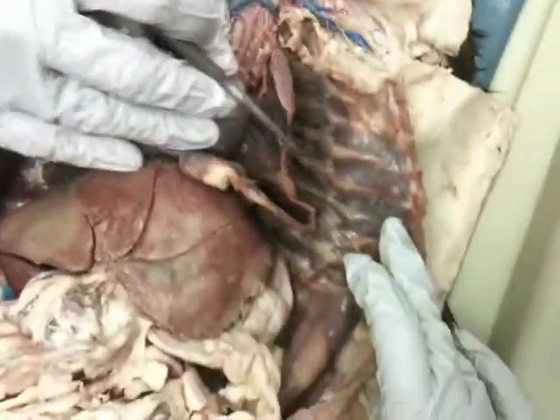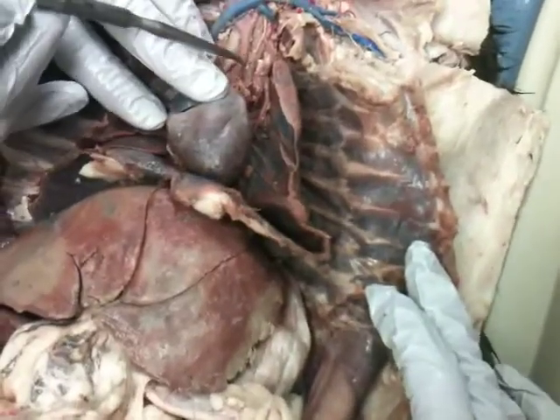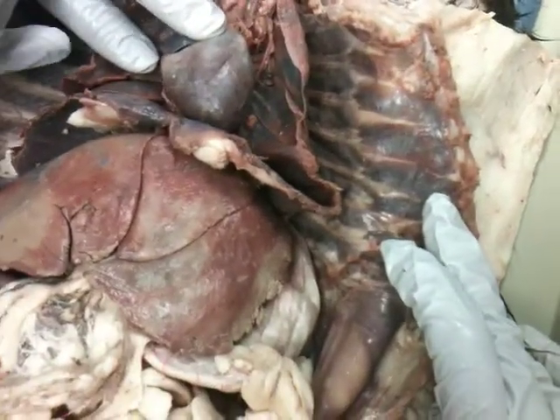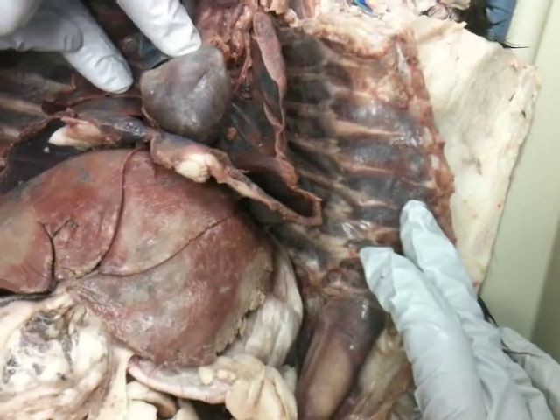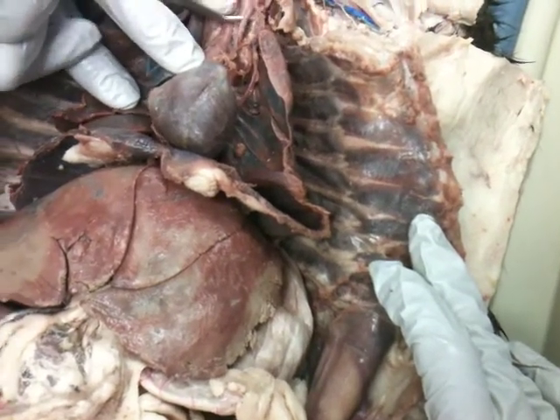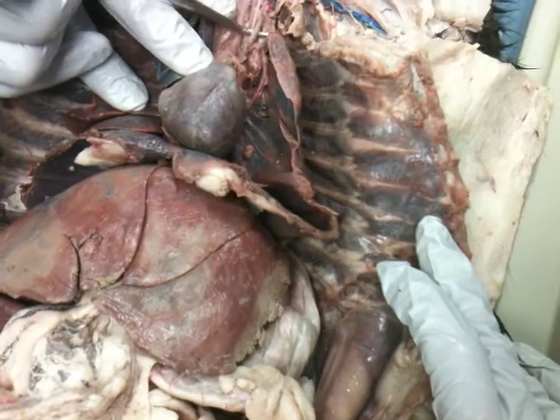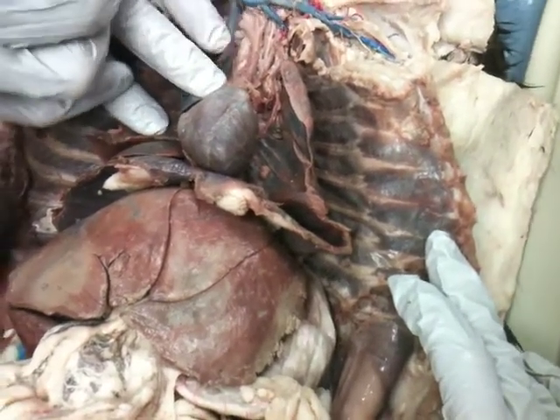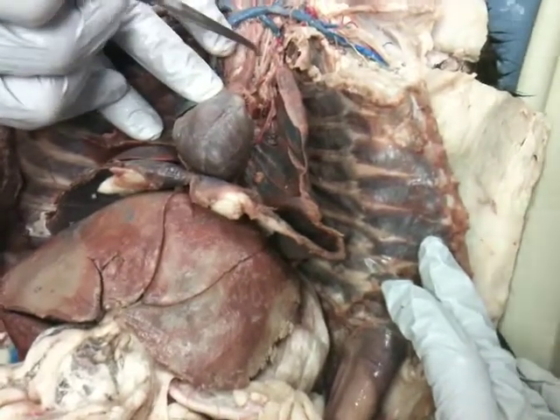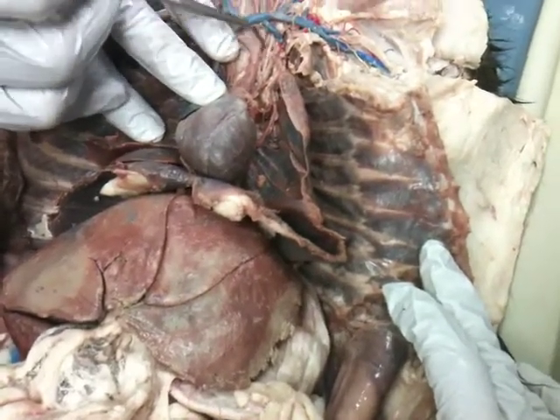On this side, similar but a little different. There is no brachiocephalic artery on the left. We just have the subclavian, the left subclavian artery coming off the aortic arch. So the right one branches off the brachiocephalic artery, correct? And then the left one comes out of the heart. Correct, exactly. So we're talking about the subclavian.